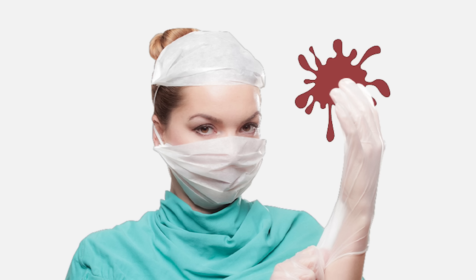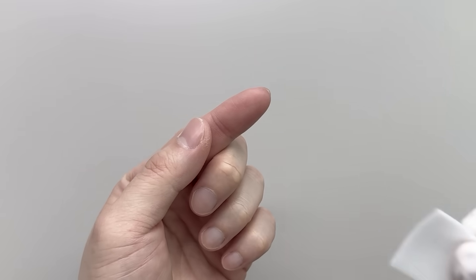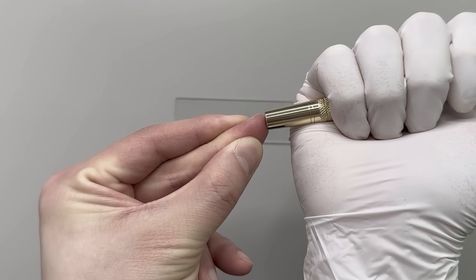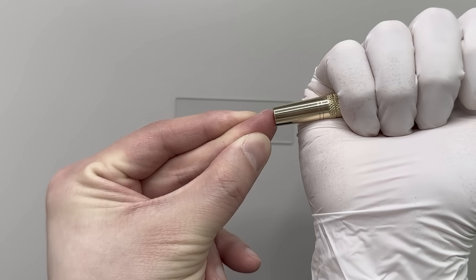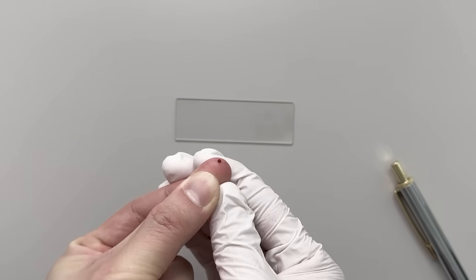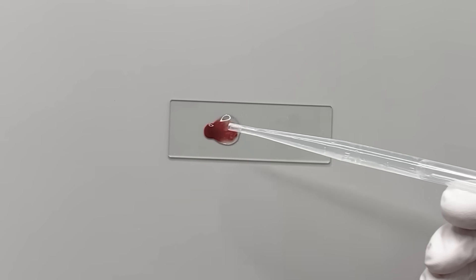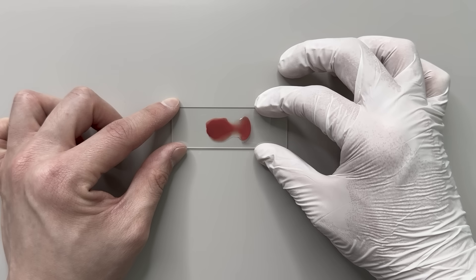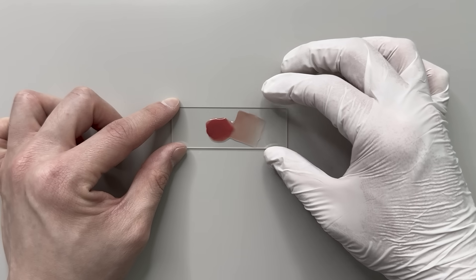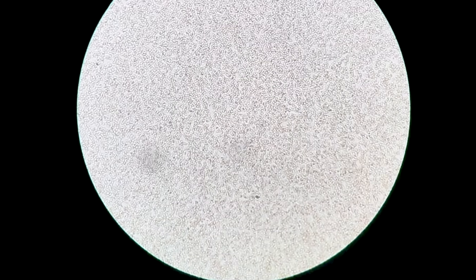Today, we'll explore blood types. To start, after lightly pricking my finger, I drop some saline solution on it, then cover it with a glass slide, and magnify it under a microscope.